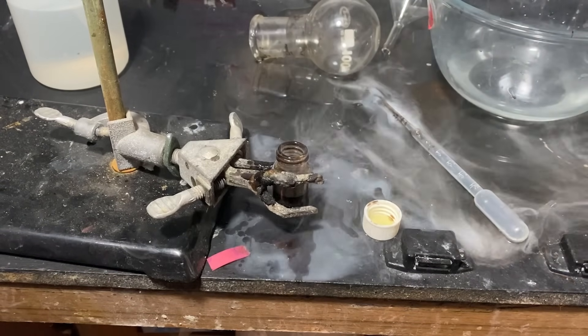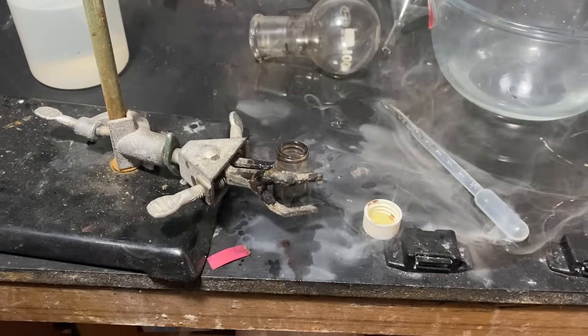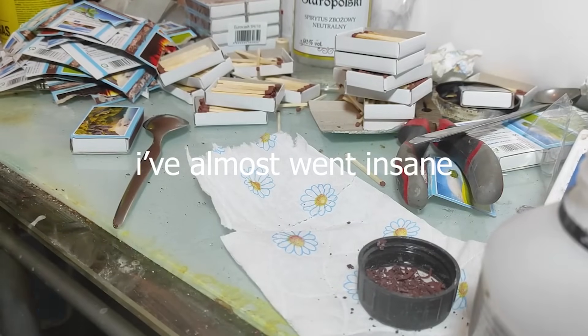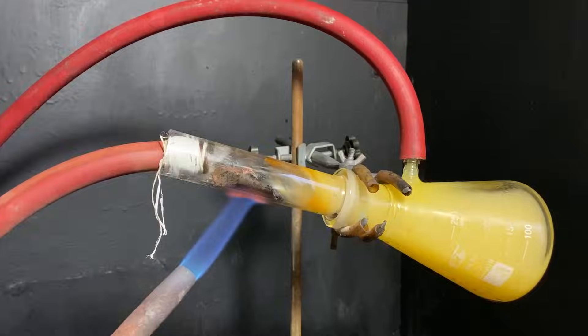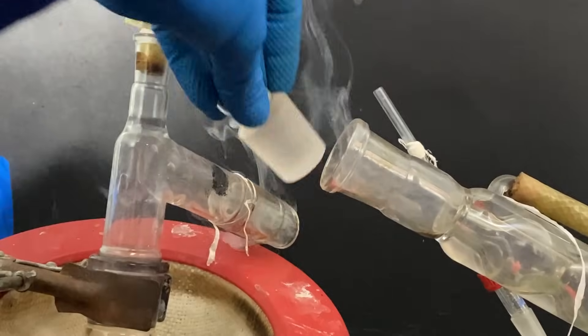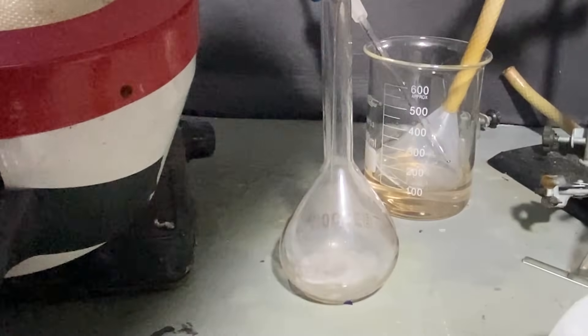Anyway, this was the first way of making the superacid, and it's the most common one in small-scale operations. But what if you don't have red phosphorus and don't want to scrape a hundred matchboxes or give your data to the government? What if you're afraid of a painful death from inhaling chlorine gas? Or what if you just build different like I am? Then, my friend, I present you the industrial route, which involves making oleum, which is just sulfuric acid on steroids.